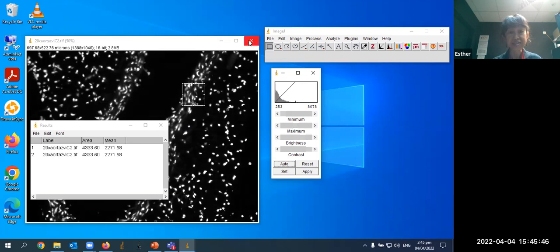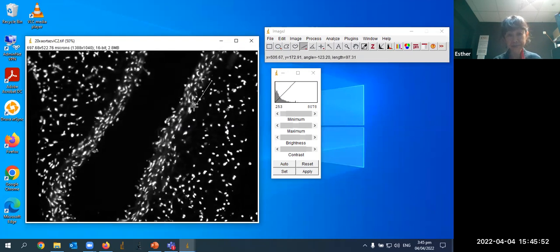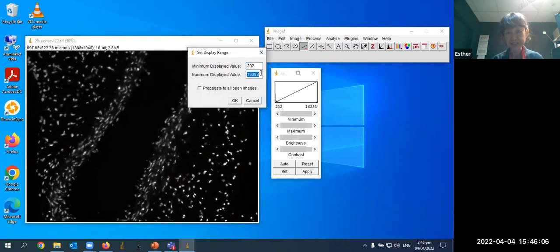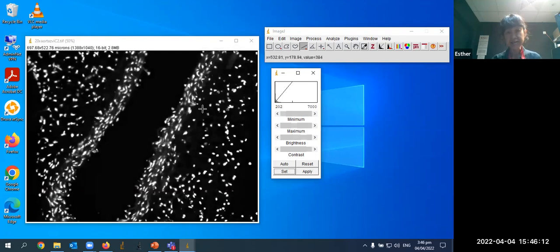So if you're using ImageJ, it's easy to do. Let me just take away the ROI. Okay, and reset. Okay, so if you want to set the maximum at a particular value, all I have to do is come here and say, I want to set my maximum at, say, 7,000. Okay, and there. So you can set this for all your images, and then you'll be comparing it at the correct settings, not one brighter than the other, arbitrarily set by you, so that you don't mislead your audience.